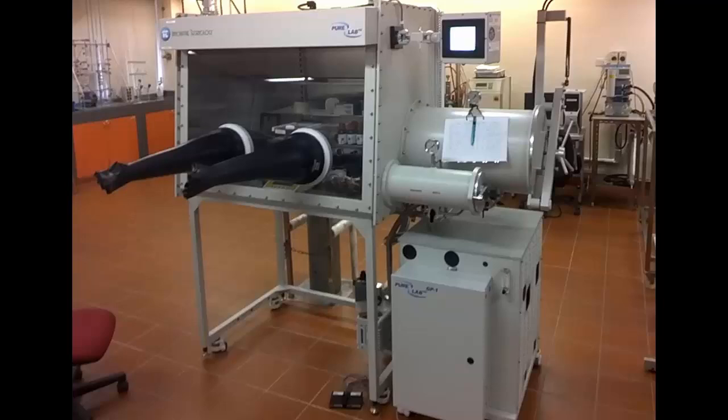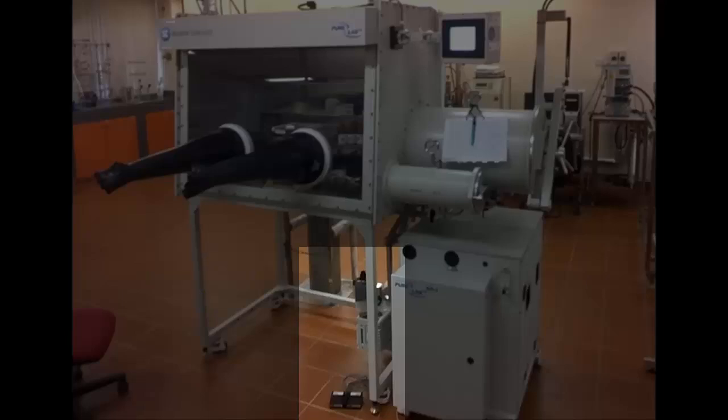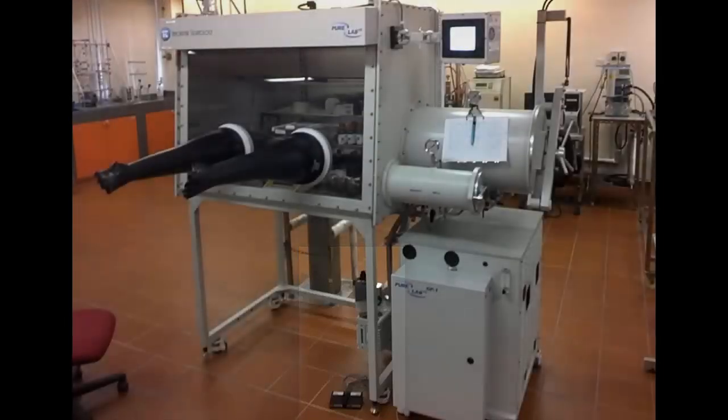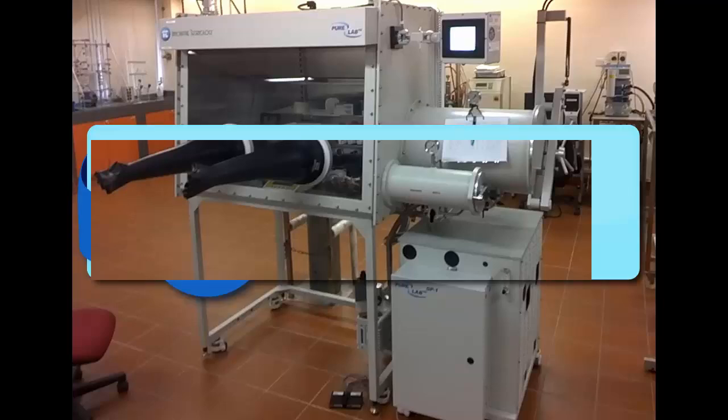There is a fan inside the box to circulate the box atmosphere through the canister. Also, the glove box must be able to regulate pressure inside. The device that regulates the pressure is said to tolerate only a few millibar of positive and negative pressure and automatically pumps nitrogen out if the pressure gets too high or draws fresh nitrogen in from a tank if the pressure gets too low. One can also regulate the pressure manually with a foot pedal.